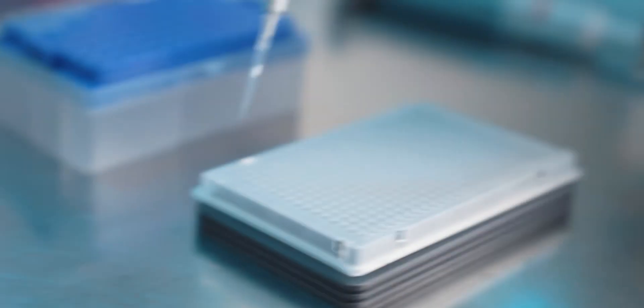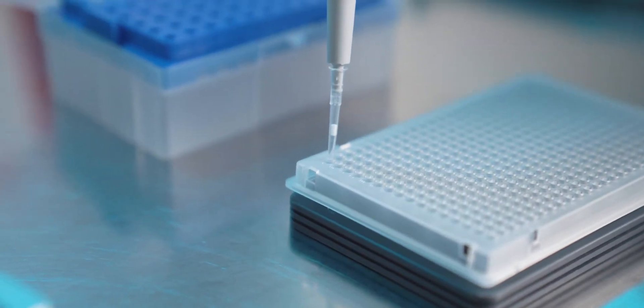It's smart to plate the master mix first into your plate. The reason you want to do this is because you're less concerned about sample contamination at this point. You can also reuse pipette tips if you want to save some money.